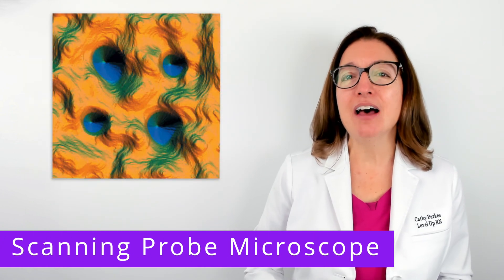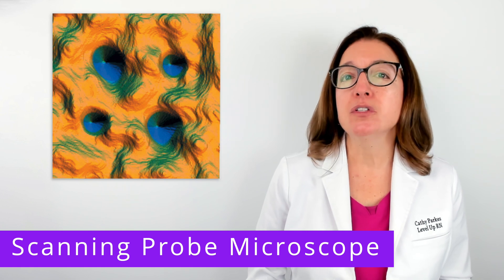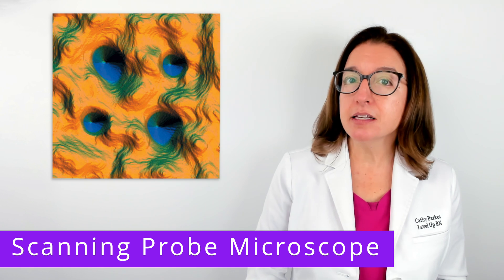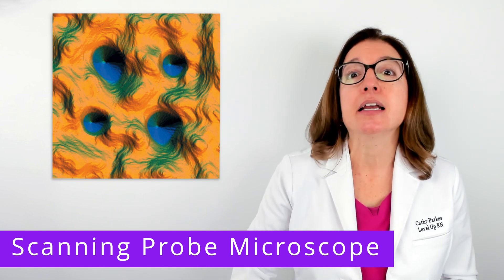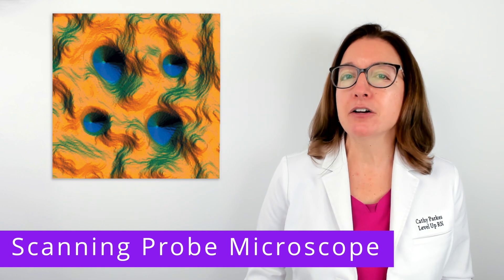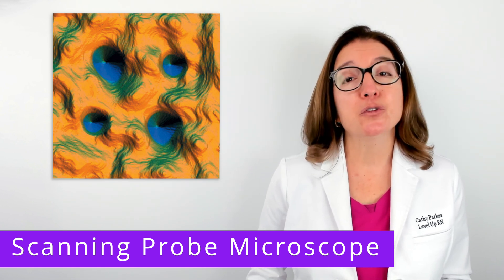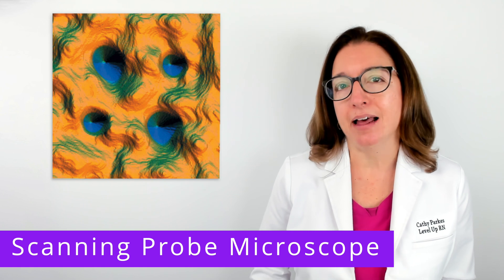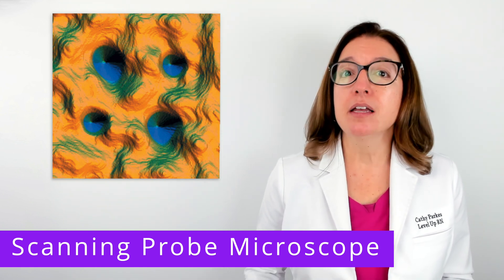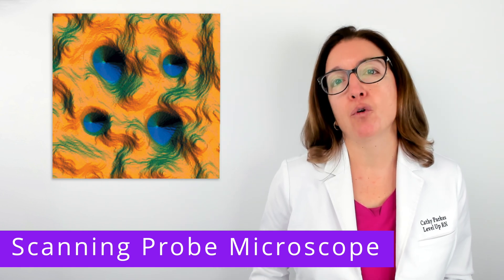Lastly, we have a scanning probe microscope. This type of microscope uses very precise probes over the specimen surface, which allows the computer to generate an extremely detailed 3D image. It is primarily used in research, and it can be used to observe individual atoms. Two key types include a scanning tunneling microscope and an atomic force microscope.